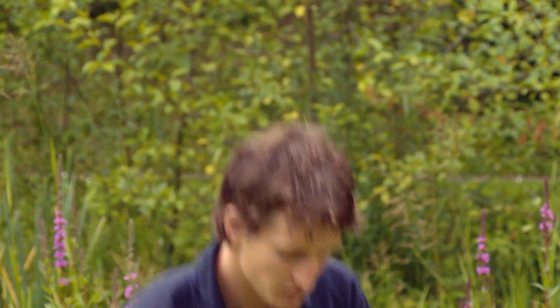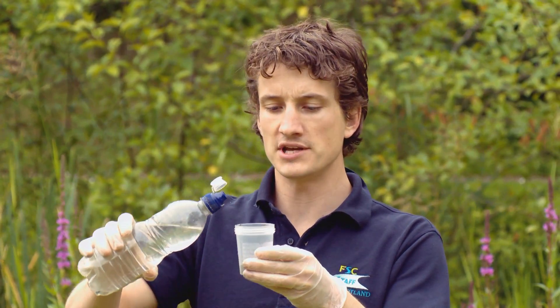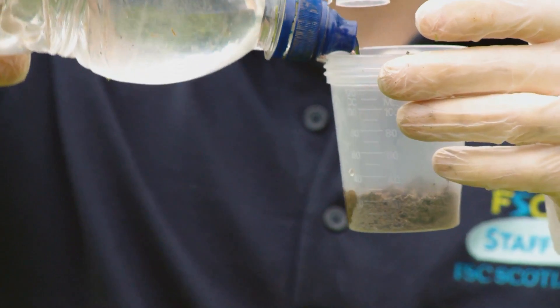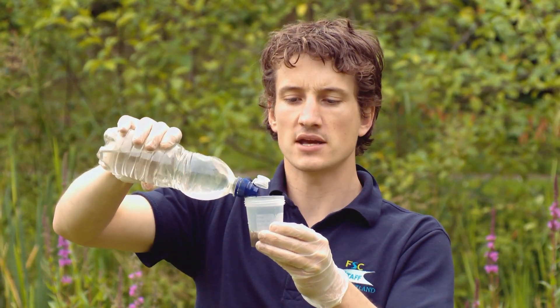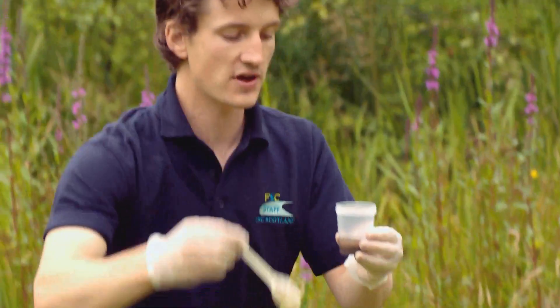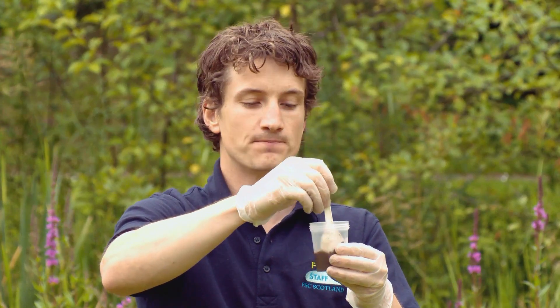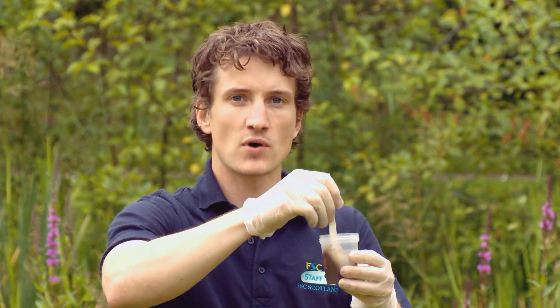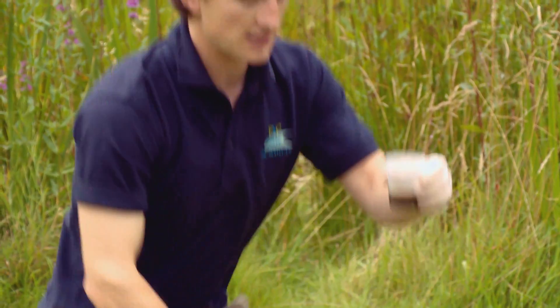I have about one centimetre depth of soil, and now I need to add some water. The water I'm using today is distilled or deionised — if you have access to that, please use it as it may give more accurate results. If not, tap water is fine too. Fill up the beaker so the water is covering the soil completely, then give it a really good stir for approximately one minute. Luckily I have one I prepared earlier which has already been stirred.